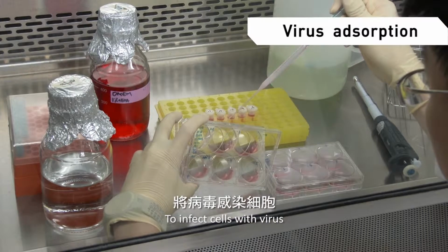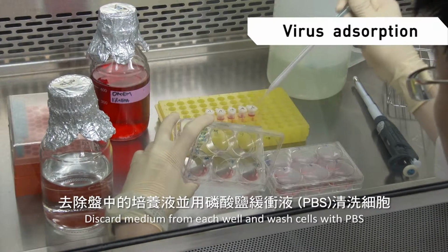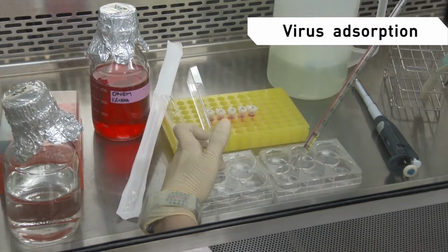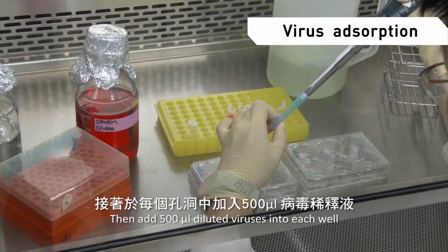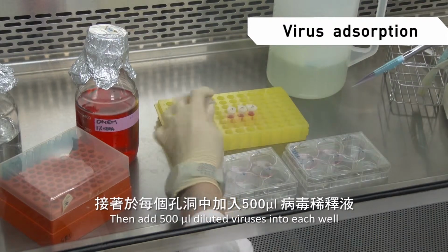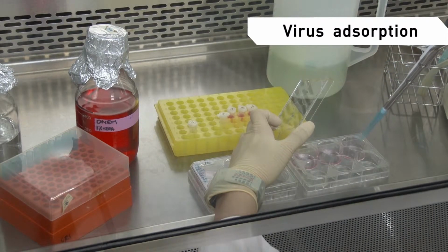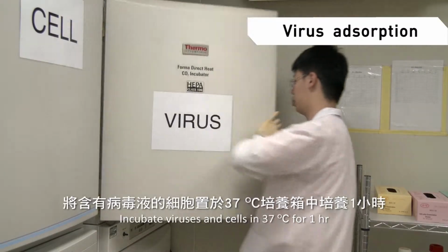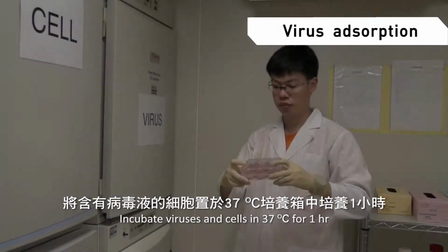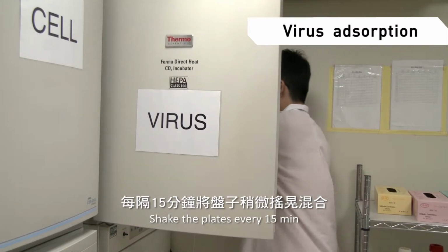To infect cells with virus, discard medium from each well and wash cells with PBS. Then add 500 microliter diluted viruses into each well. Incubate viruses and cells at 37 degrees Celsius for 1 hour. Shake the plates every 15 minutes.